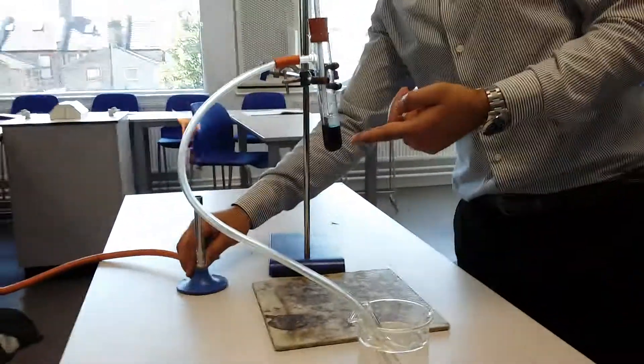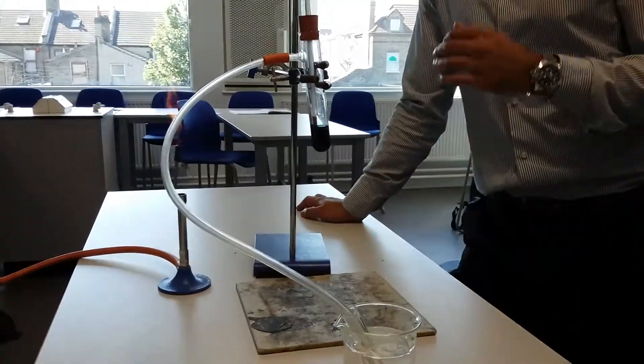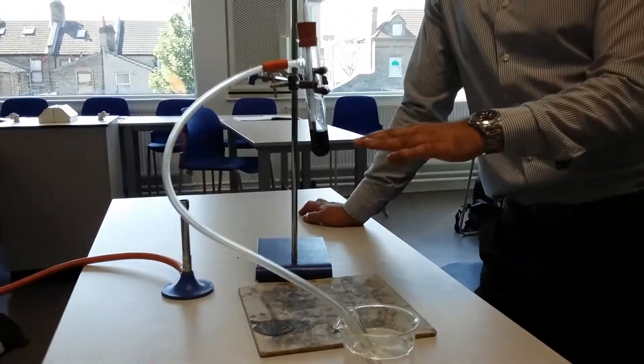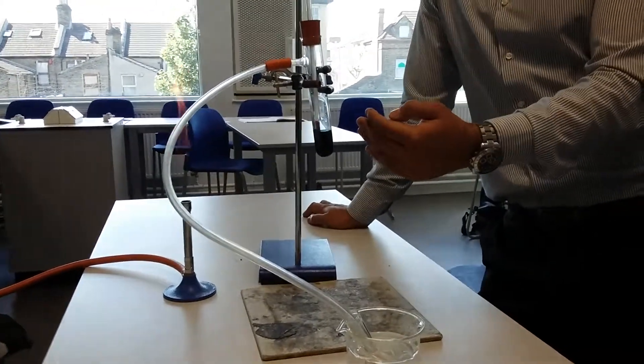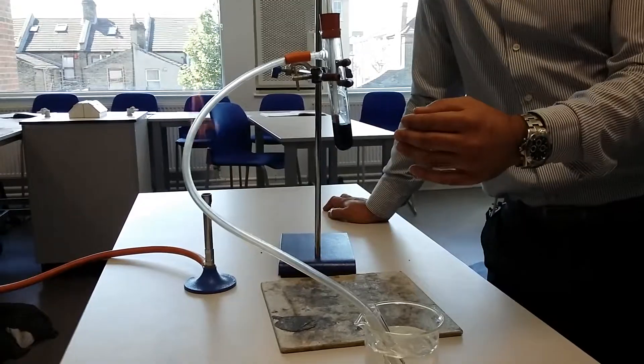So I've got my crude oil over here. Now there are two stages to this, very important stages. One stage is boiling and the second stage is condensing.